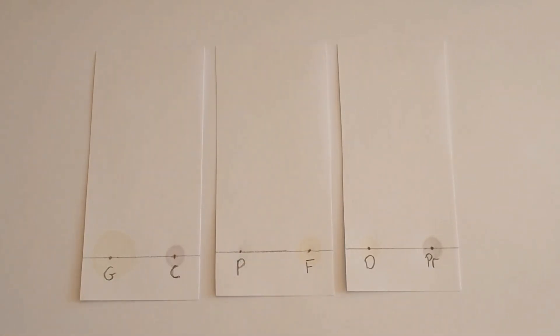Now what we're going to do is we're going to run these chromatography pieces and I'm going to show you how to do that. Oh there was one thing though, this is too big of a spot. I got a little carried away, really we want it to be about this size or this size, not too much bigger because then they don't have a good opportunity to spread out properly.